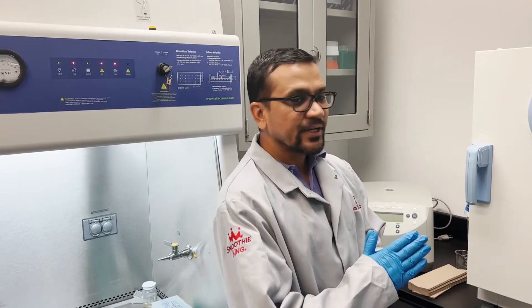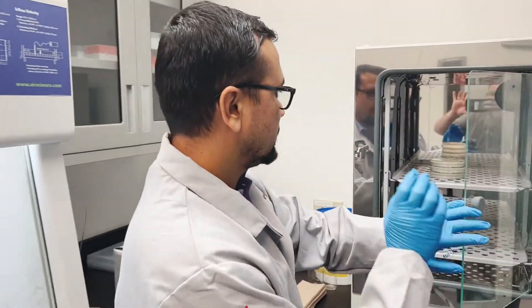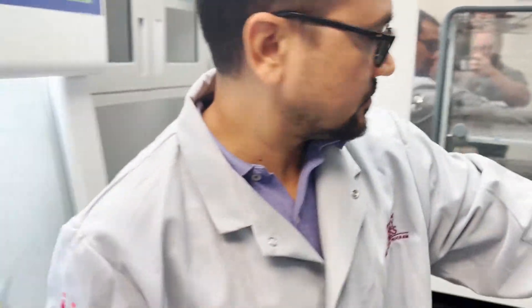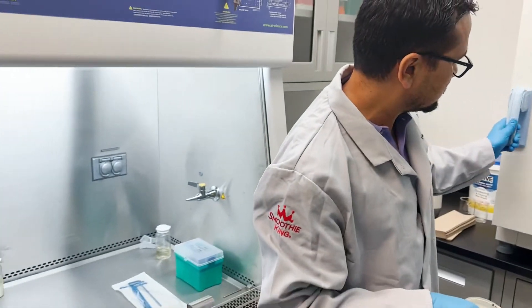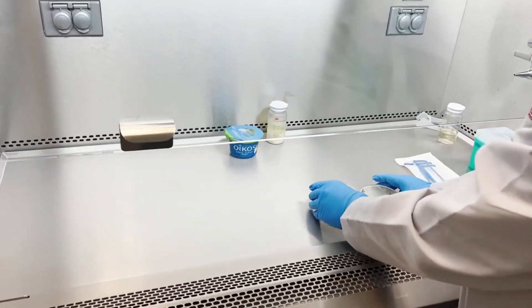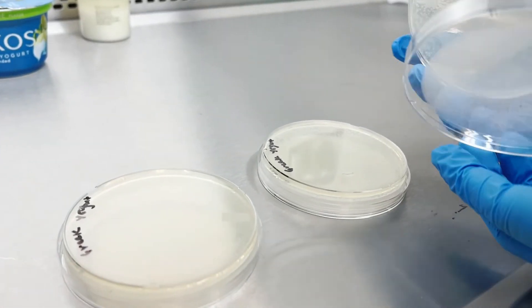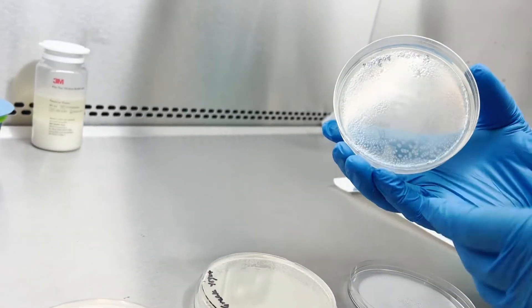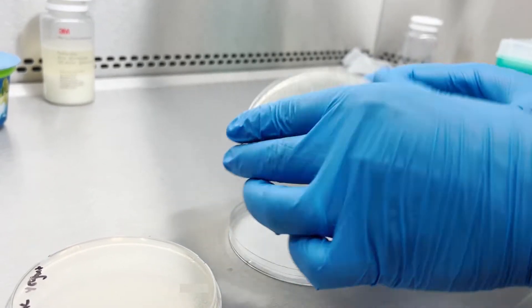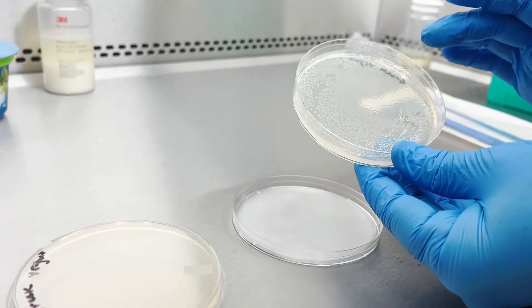After 48 hours I'm going to take out those incubated plates from the incubator. After 48 hours you can see there is microbial growth — you can see the white colonies in each plate. They are the microorganisms from the Greek yogurt.